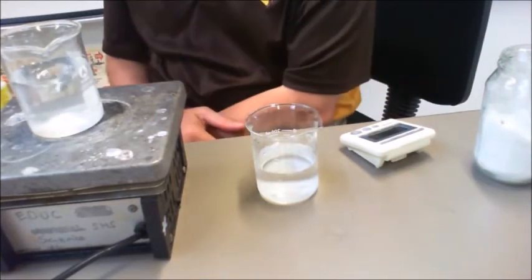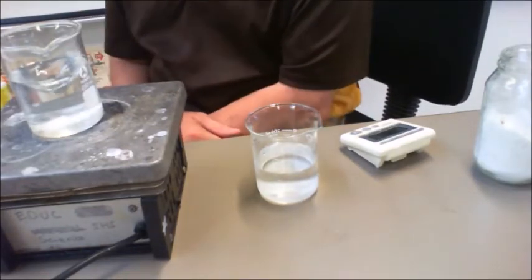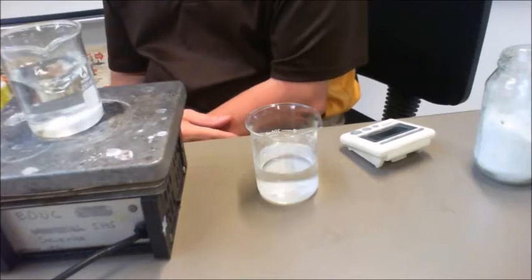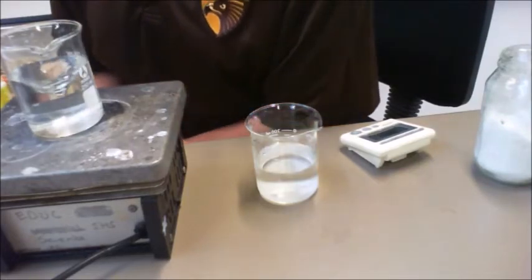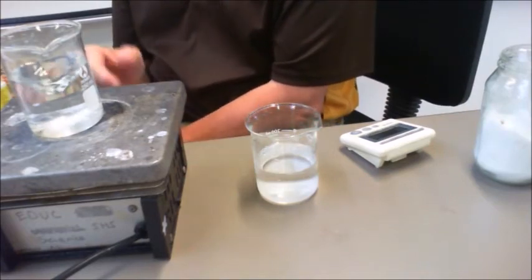Now, as you can see, it hasn't taken very long for the agitation to assist. At the 22-second mark, it looks like from what I can see that it's basically fully dissolved.